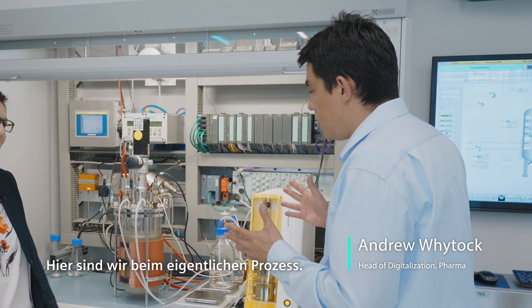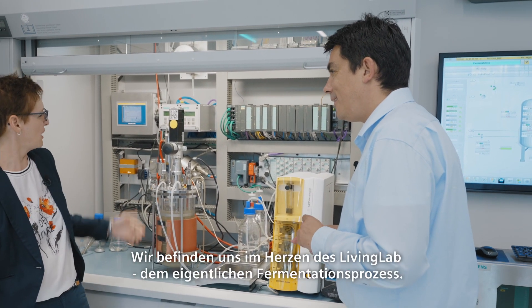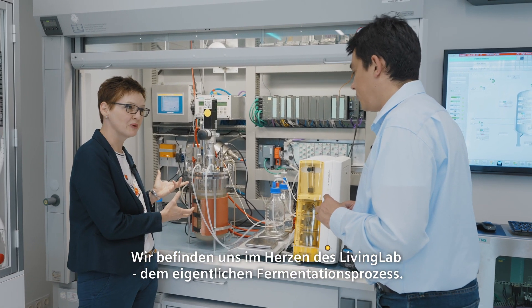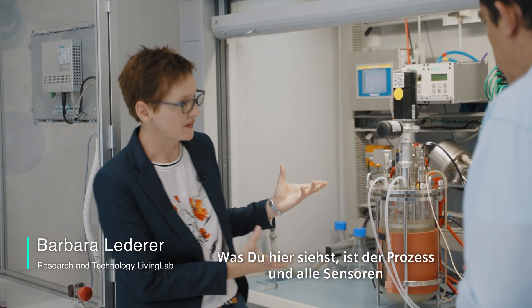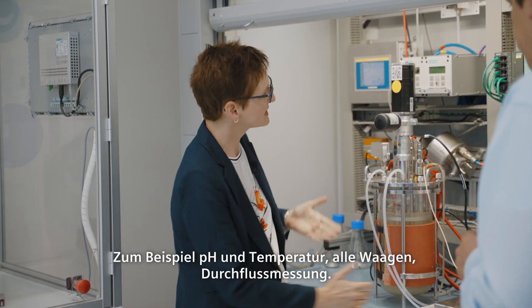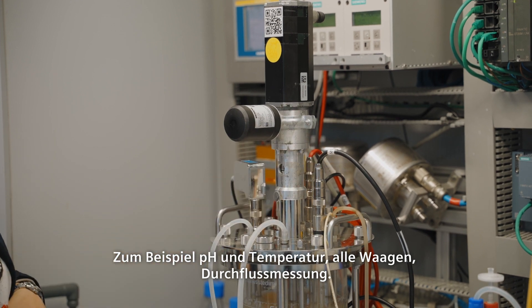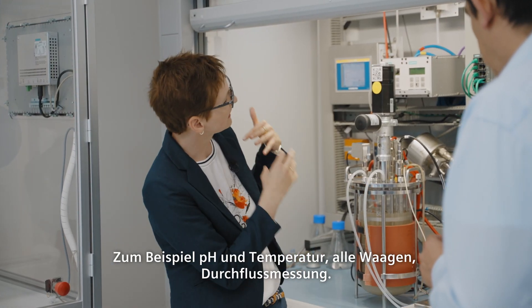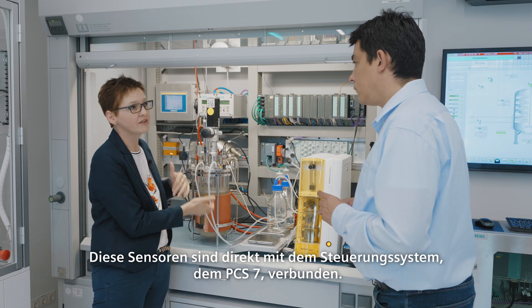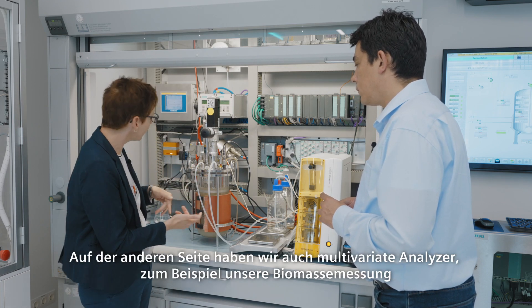We are directly at the heart of the living lab — the fermentation process itself. What you see here is the process and all the sensors and analyzers connected to it, for instance pH and temperature. You get all the balances, you get the flow. These sensors are directly connected to the control system, the PCS-7.